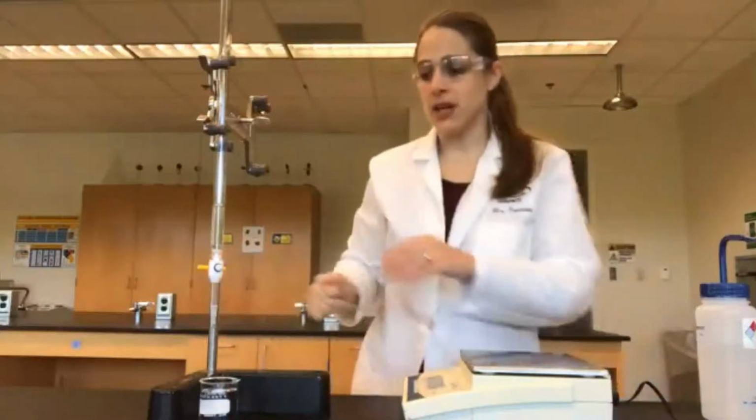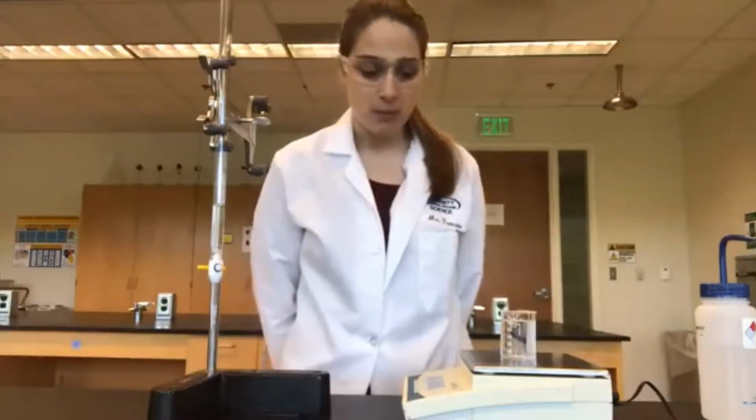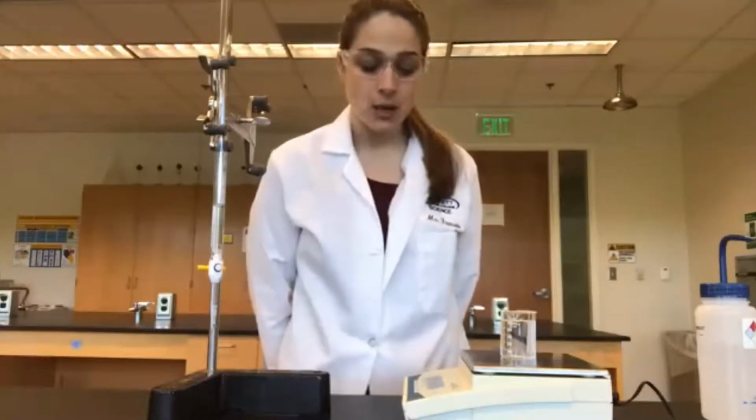And we stop at the 50 line. So we've now added 50 milliliters of water, and our final mass is 78.22 grams. So we have now used all 5 different pieces of equipment in 10 milliliter increments.